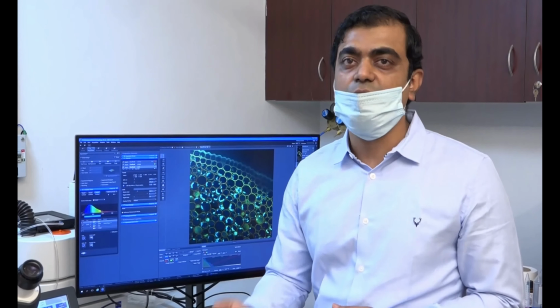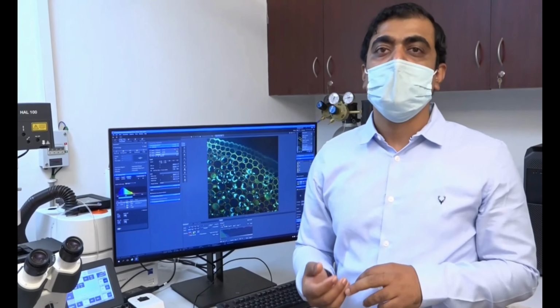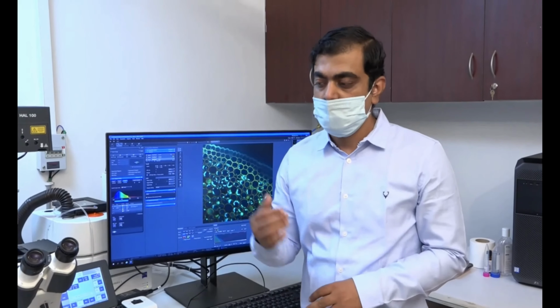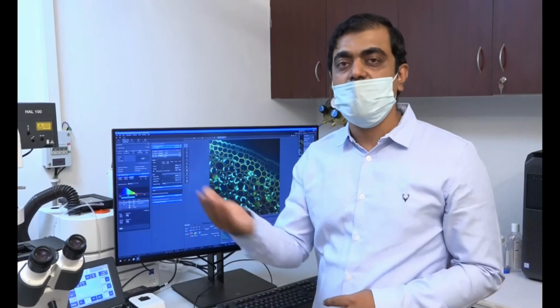Okay, once we have done a multi-channel, we would definitely like to use this system for Z resolution, because confocal is always known to give a very good Z resolution. That is why we will be taking a Z stack and we will try to do optical sectioning of a sample which is very thick. So for example, if it is a tissue or a TS section of a stem, that can be virtually sliced by using this system. You don't have to go for microtome sectioning and all.